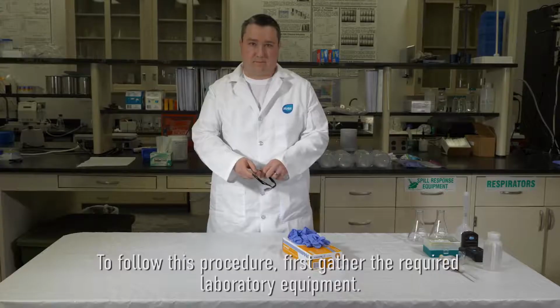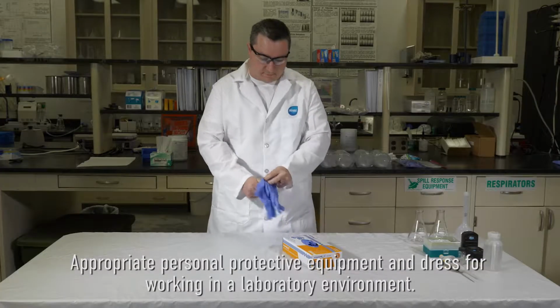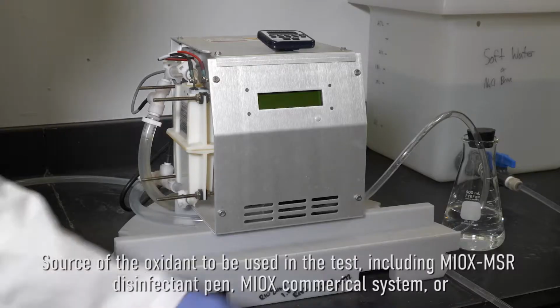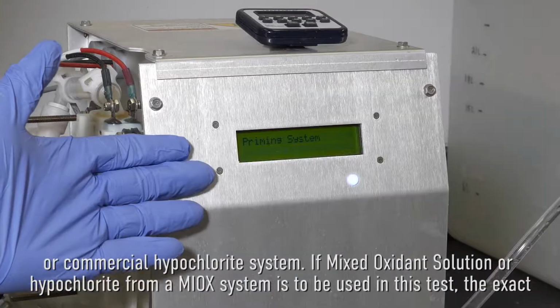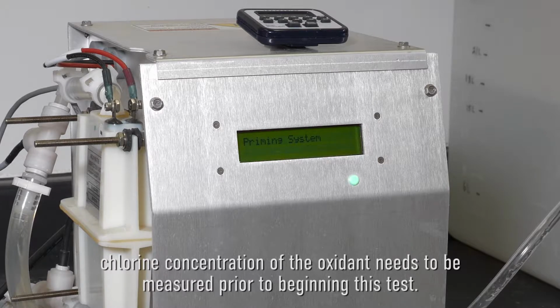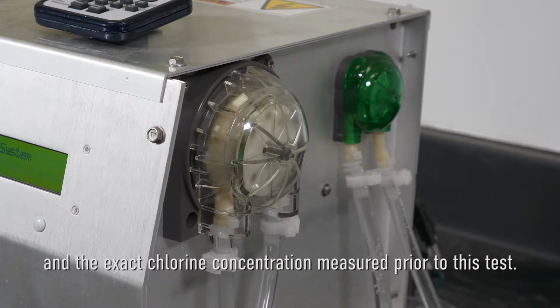To follow this procedure, first gather the required laboratory equipment. Appropriate personal protective equipment and dress for working in a laboratory environment. Source of the oxidant to be used in the test, including MIOX MSR disinfection pen, MIOX commercial system, or commercial hypochlorite system. If mixed oxidant solution or hypochlorite from a MIOX system is to be used in this test, the exact chlorine concentration of the oxidant needs to be measured prior to beginning the test. If a commercial hypochlorite solution is to be used, the solution should be diluted to a chlorine concentration of around 1% and the exact chlorine concentration measured prior to this test.